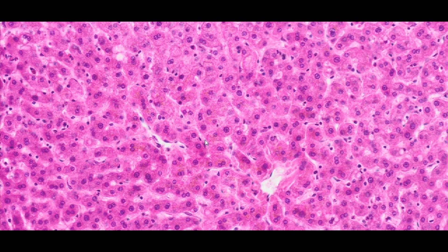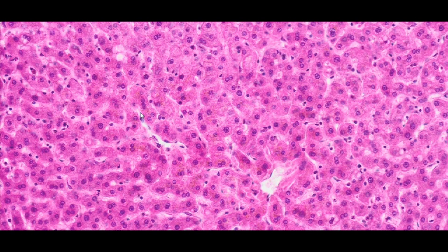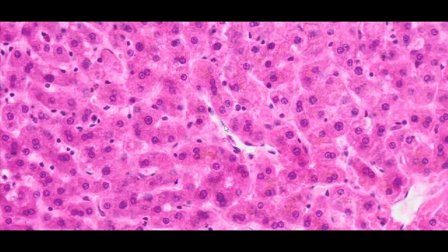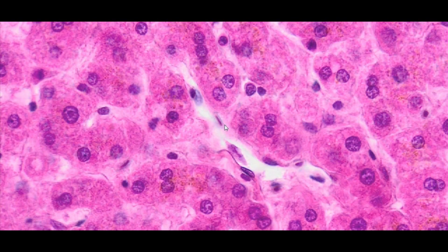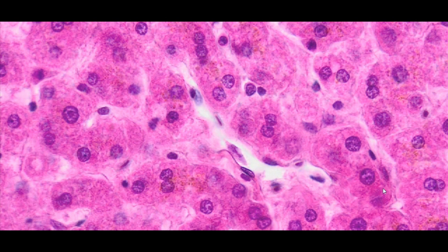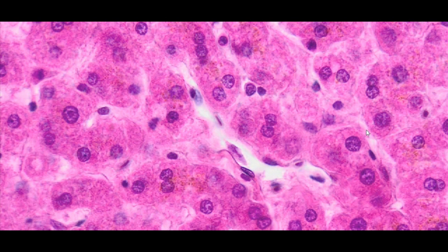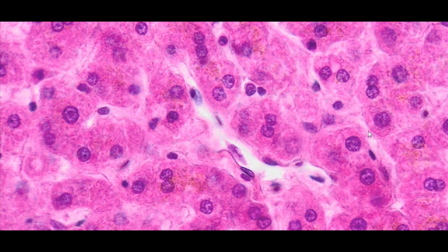The spaces between the lamellae are occupied by the sinusoidal vessels of the liver sinusoids, to which blood flows from both the portal vein system and the hepatic artery. They are separated from the hepatocytes by the space of Disse.